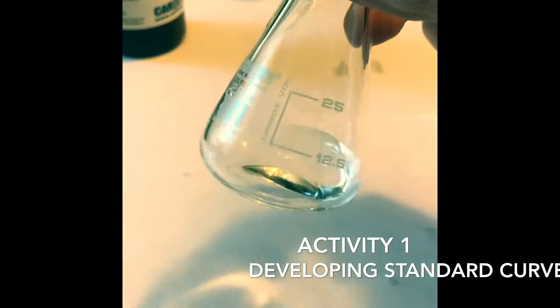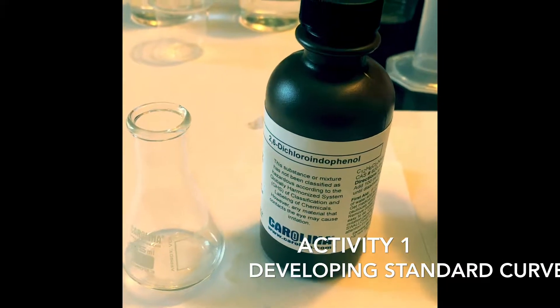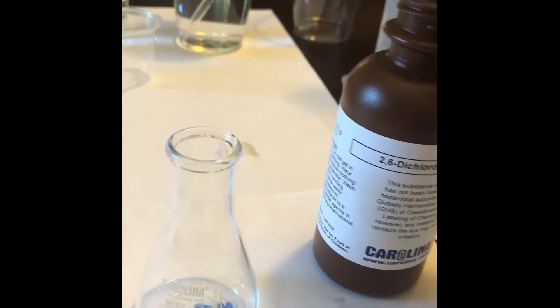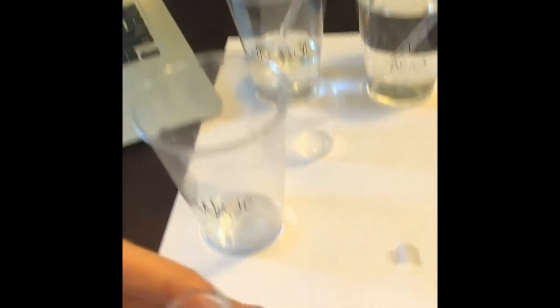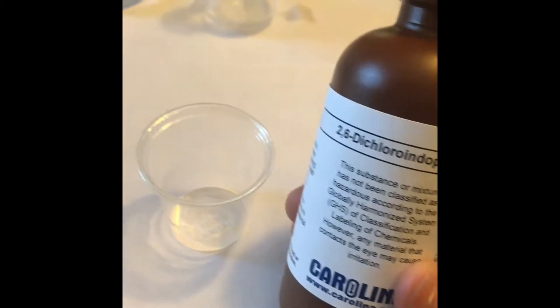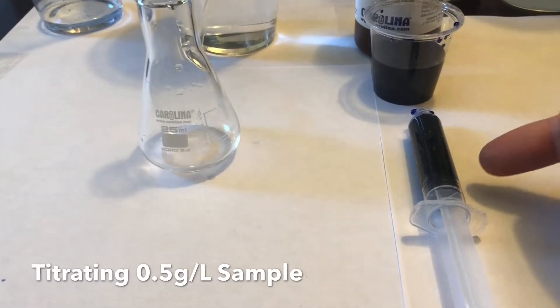Activity 1 is developing a standard curve. I put 2 ml of pure water in the Erlenmeyer flask. Now we'll use a dropper to put in one drop of the DCPIP solution to turn it blue and indicate the end point. Dispose of it in the waste, rinse it out. Fill the medicine cup about half full with the DCPIP solution and get 5 ml of DCPIP solution in the syringe.